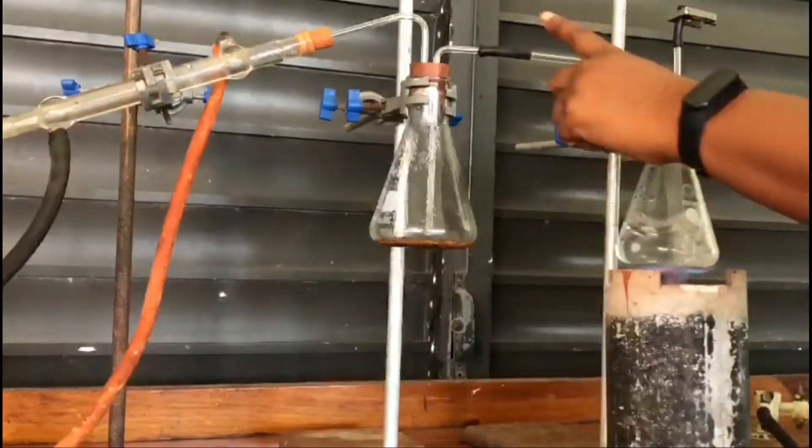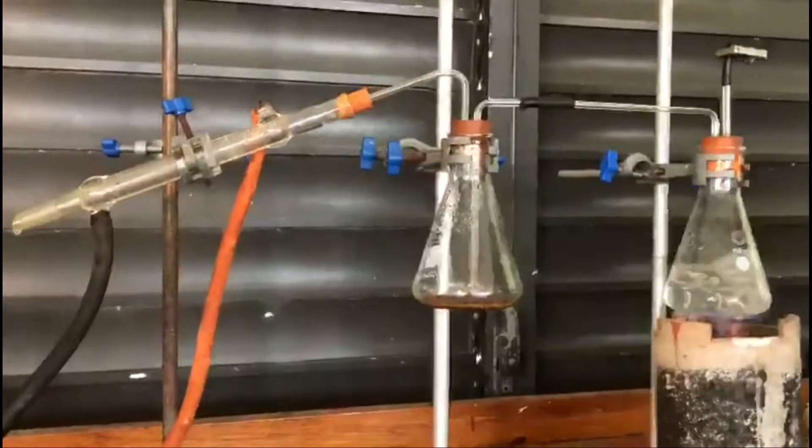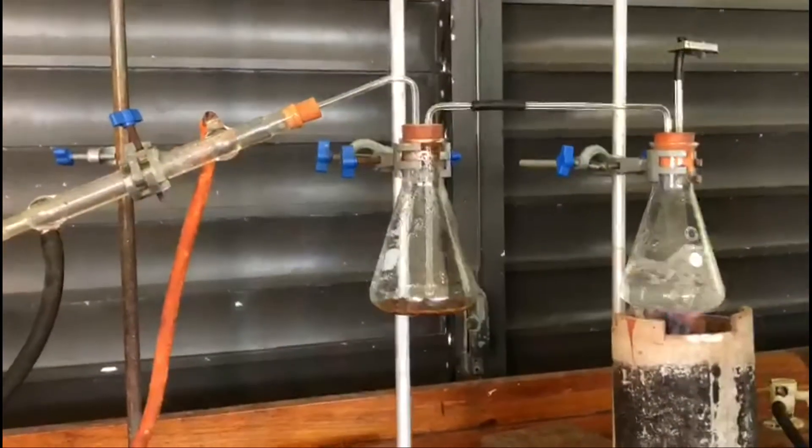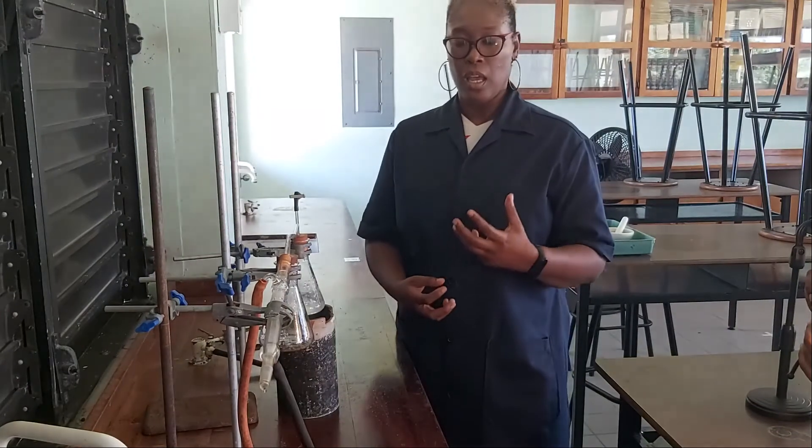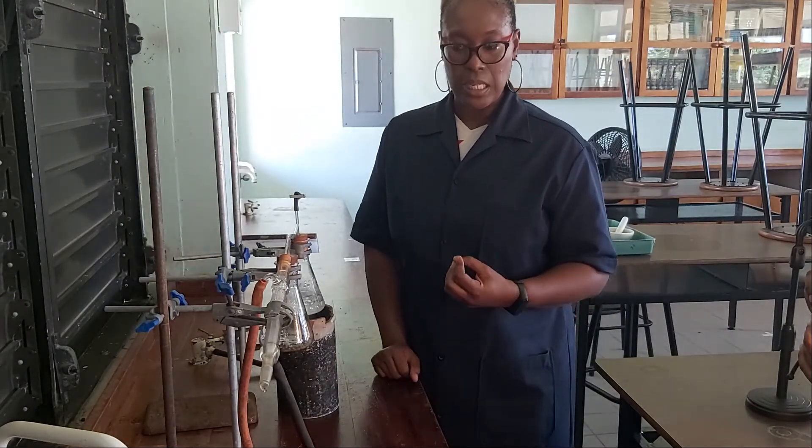This bubbling that comes as the vapors condense is agitating the mixture, allowing it to get well mixed to better allow our separation to occur.